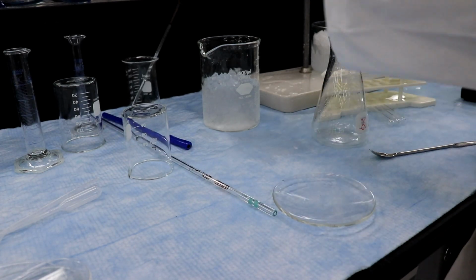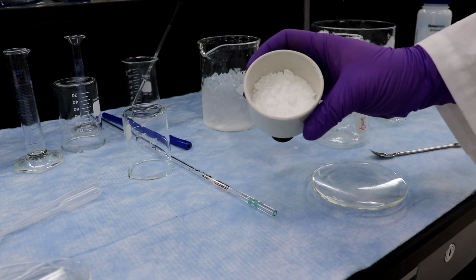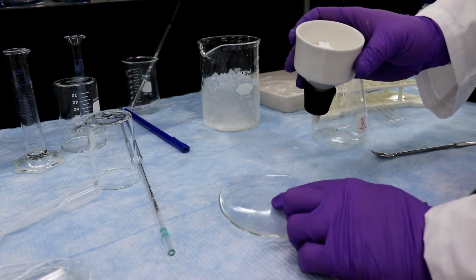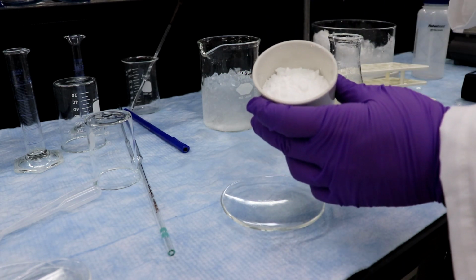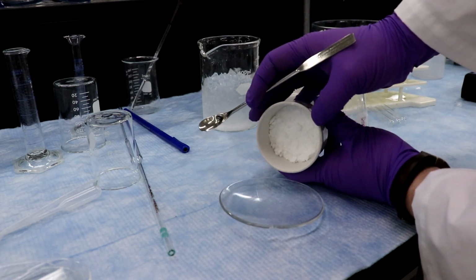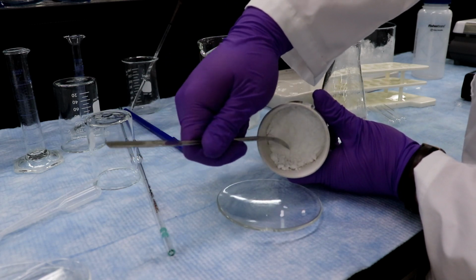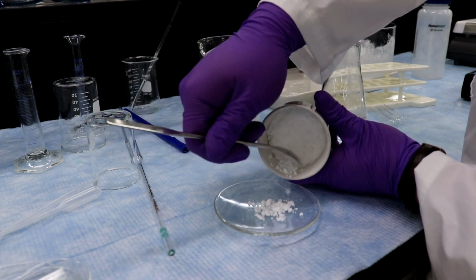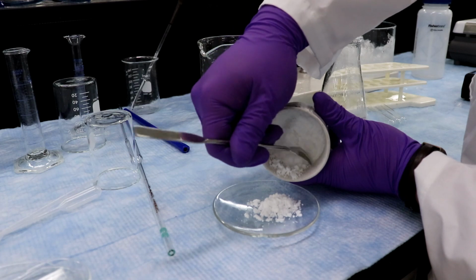Now here's the fun part right here, because we have all this white crystal here, and we want to make sure that we can get as much of it onto this watch glass as possible without scraping the actual filter paper itself and just ruining everything. And we have to figure out how to do this so that I don't break my wrist in the process of all this bending. Okay, so what you want to do first is basically lightly scrape off anything that'll come free.